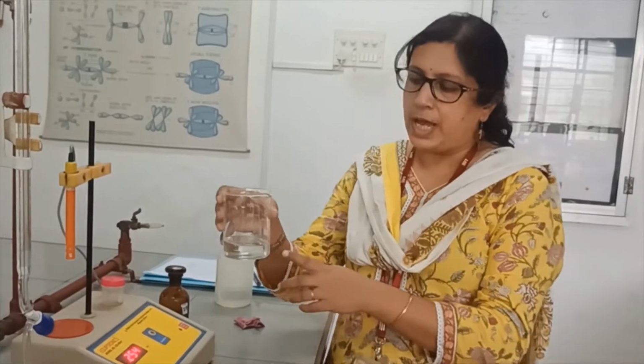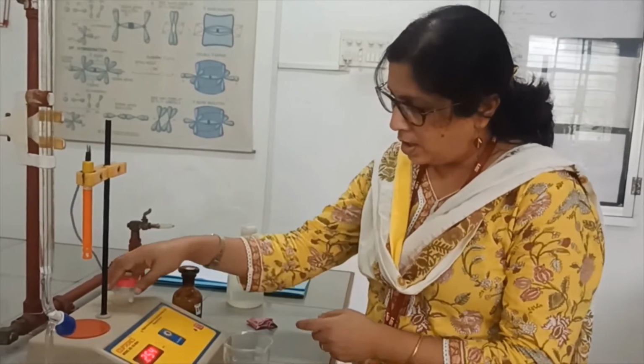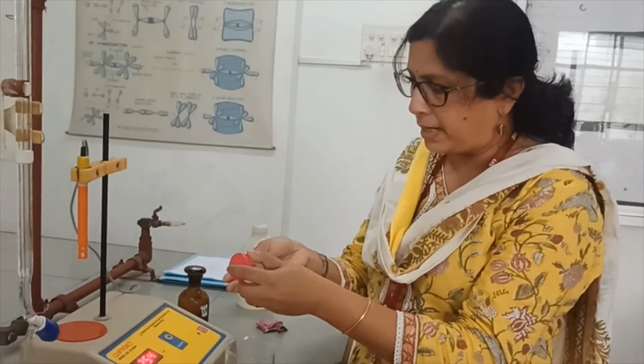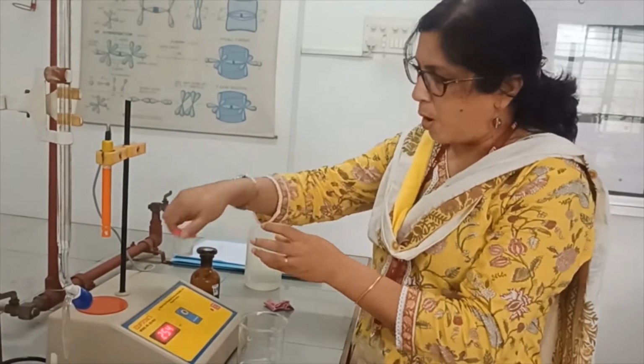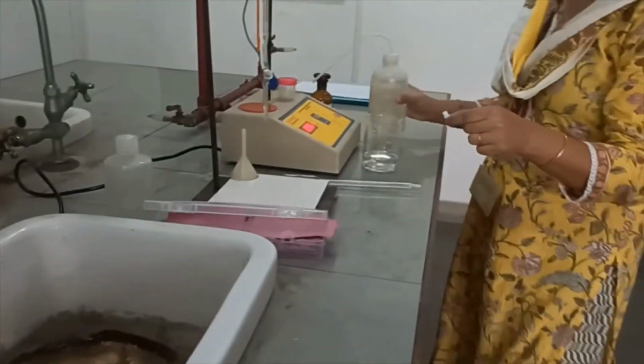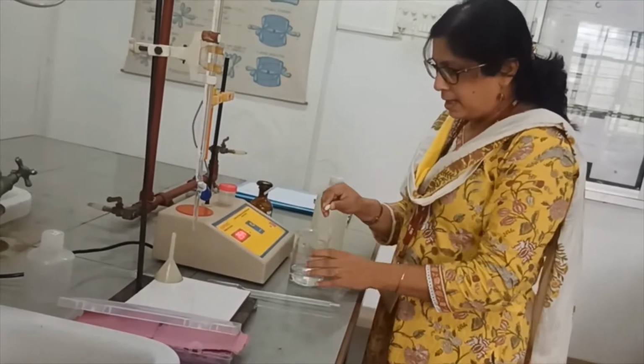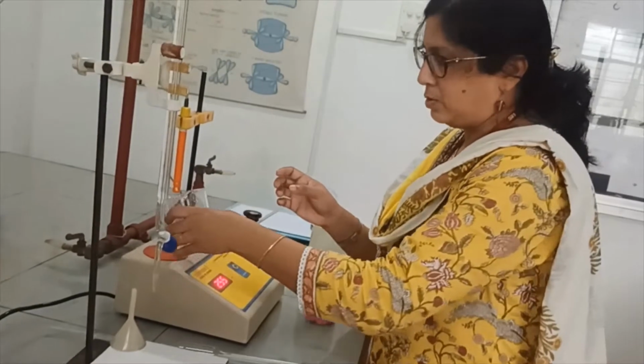While adjusting the burette solution, you have to bring the burette so that the 0 mark is at your eye level, and that is how you have to adjust the volume of the solution in the burette. So we have taken 40 ml of the analyte here in the beaker, and now you can see that there is one magnetic bead kept in this box. That also you wash with the deionized water. Wipe off the extra water, and then gently put it into the solution.